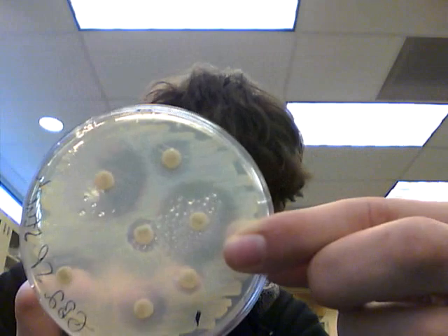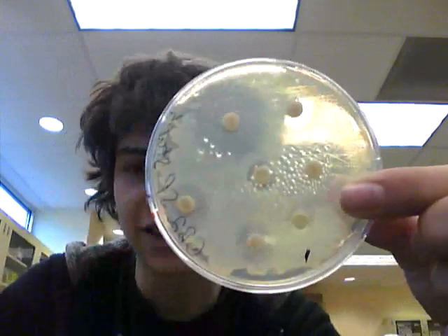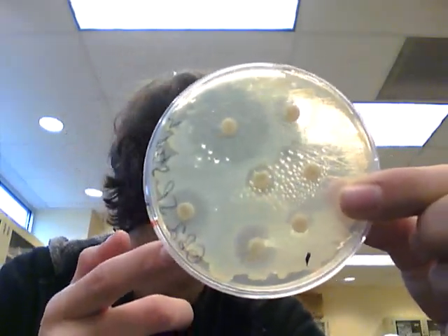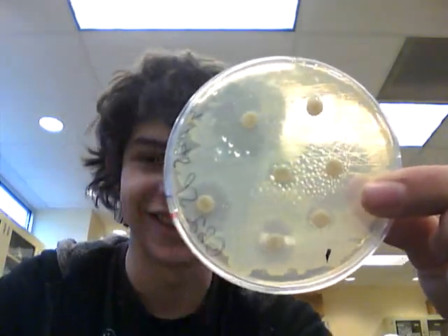Right here, the streptomycin zone is tiny. And that's not surprising because this is strep bacteria.